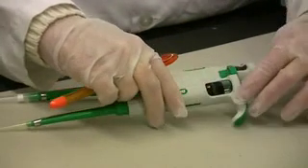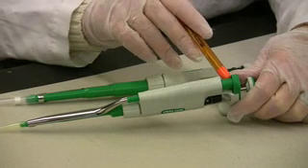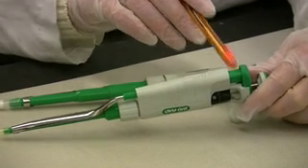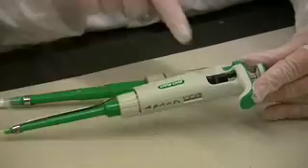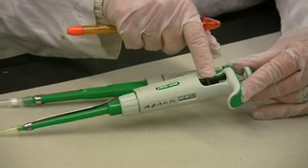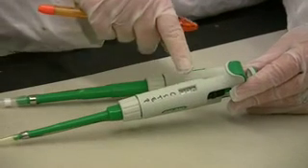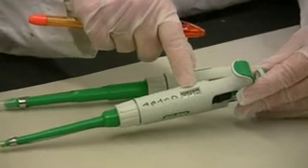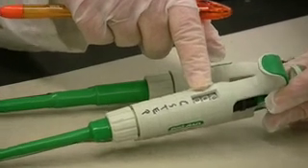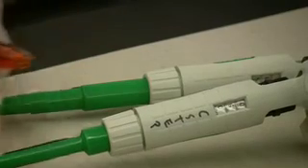Additional parts include the tip ejector button, which is used to eject the tip after the use of the micropipetter; the volume adjustment knob, which is used to adjust the volume that you wish to transfer; and the digital display window, which is used to display what volume you will be transferring.